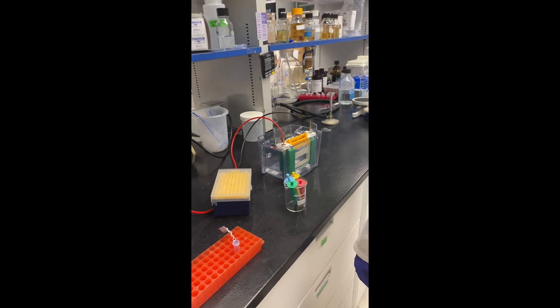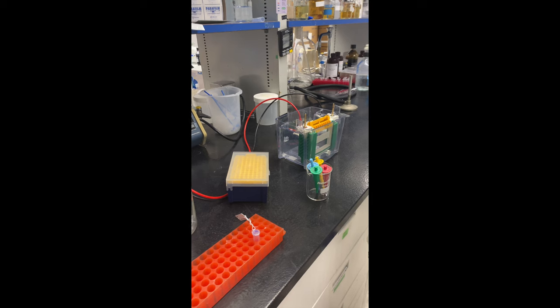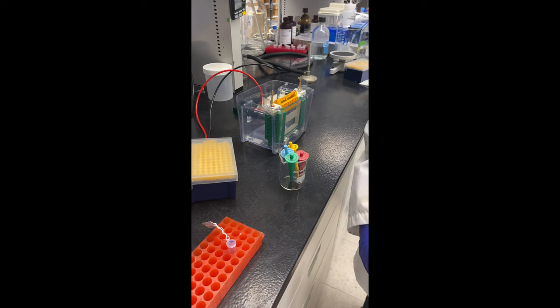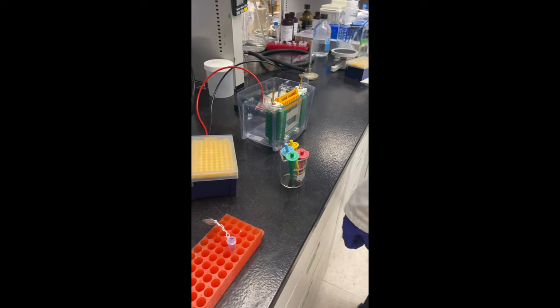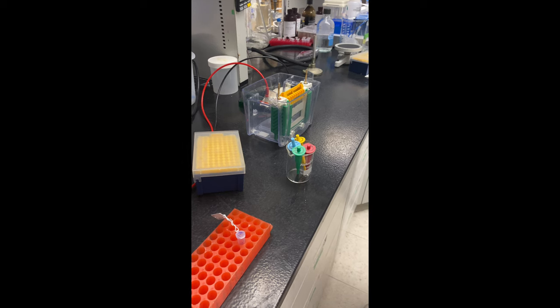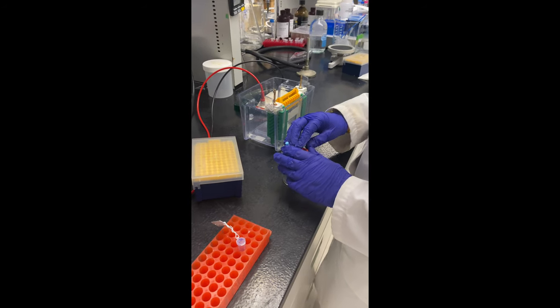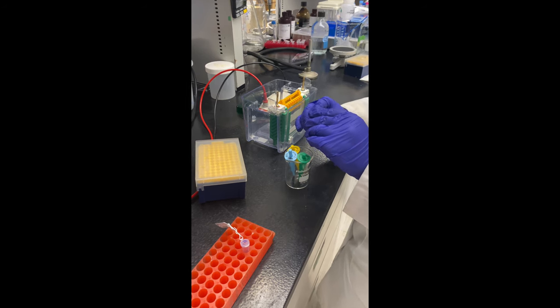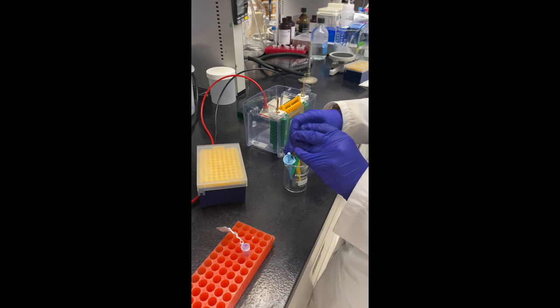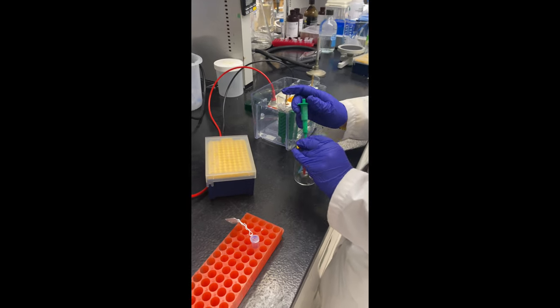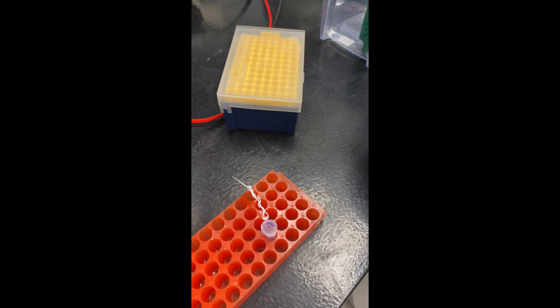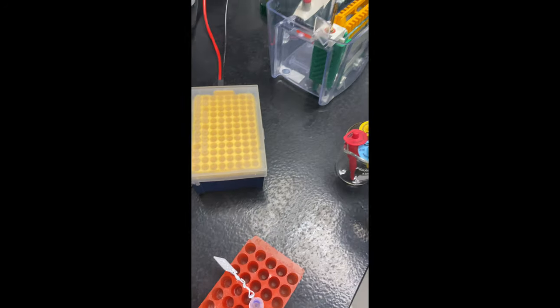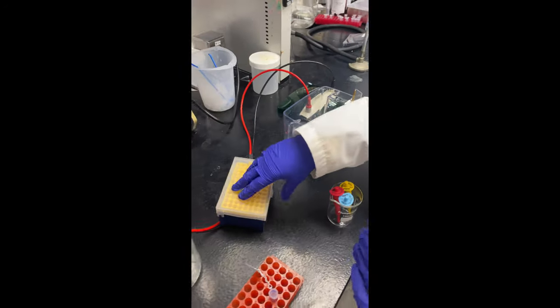Let's show the loading guide and how it matches up with the wells. So what value do we need? 10 microliters. All right. While I find that, why don't you explain to our viewers what I'm doing here? Yeah, so Emmy is filling the four different fixed volume micropipettes. For the braille label that says 10 microliters, she's going to get a tip from the tip box to attach to the end, and then get 10 microliters from our blue SDS page dye with a braille label that says dark blue—it's a laundry tag metal label. Then it's going to deposit that in the second well on our gel.